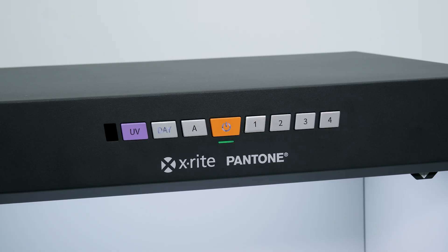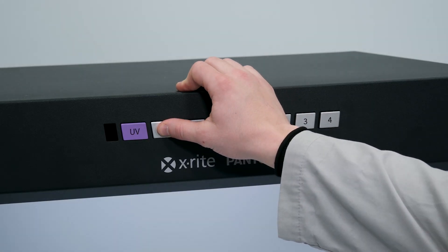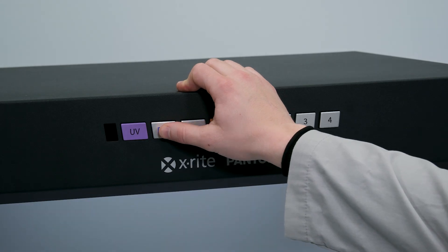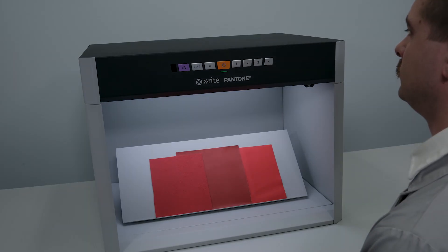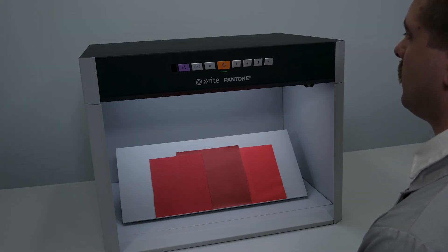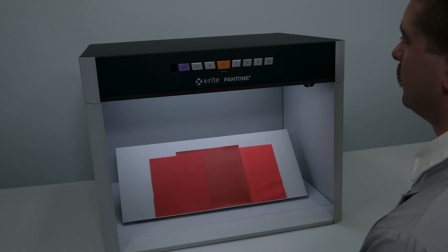Once done, press and hold the day button until the LED backlight turns blue. For best performance, the optical diffuser must be reinstalled to use the other illuminants in the system.